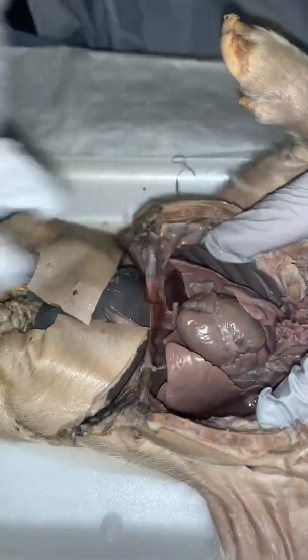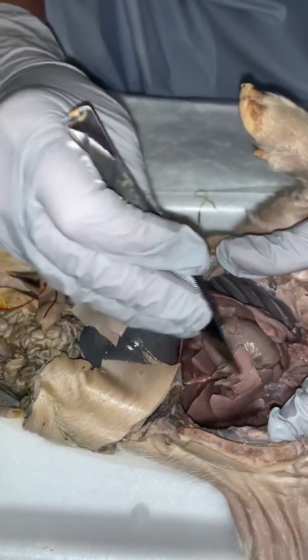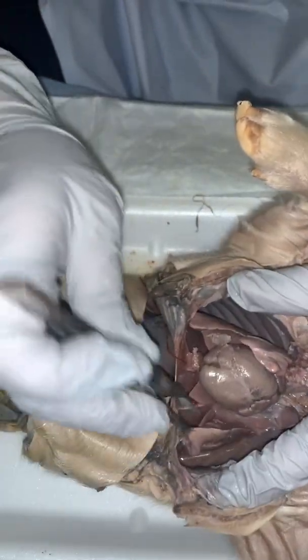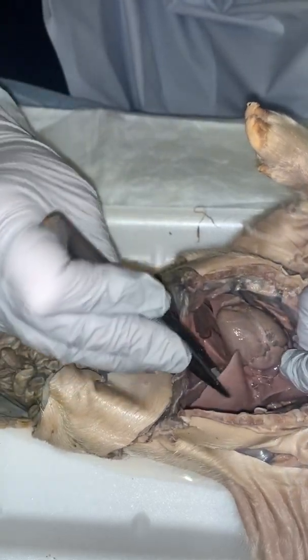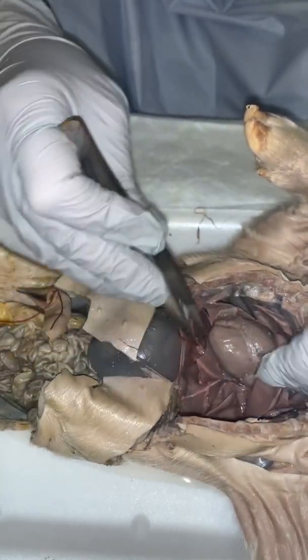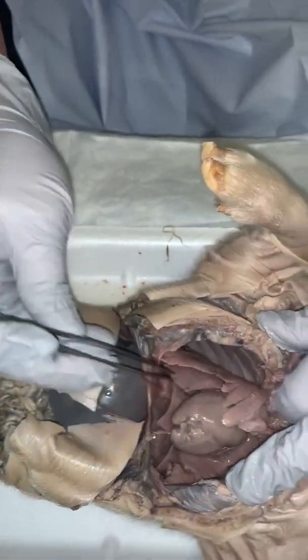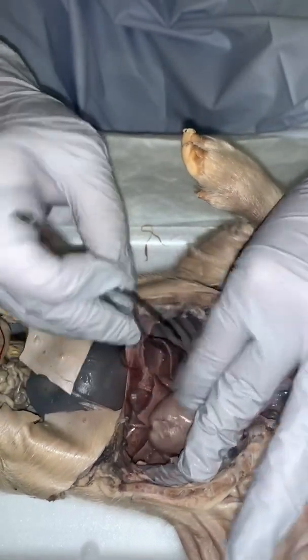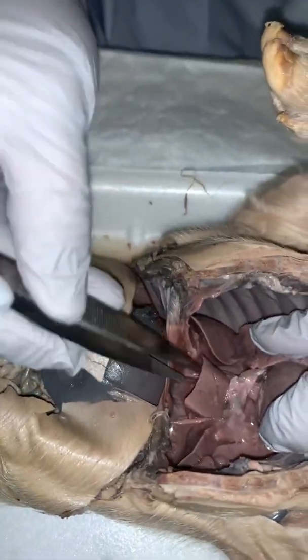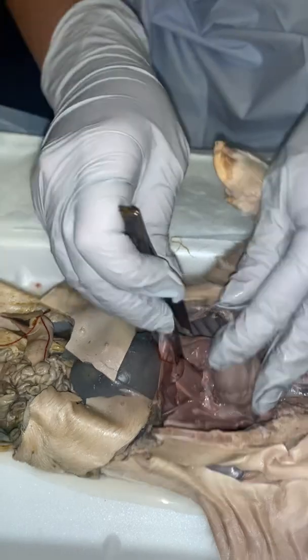And the left lung contains 3 lobes, and the right lung contains 4. So I'll show you those lobes. If you look in here, here's a lobe. Got a lobe here, kind of like flap-like. There's another one. There's a lobe. Here's a lung lobe. There's one. And there's one as well. There's the lobes of the lungs. The lungs rest on the diaphragm.